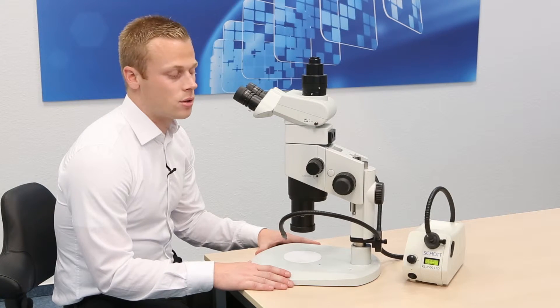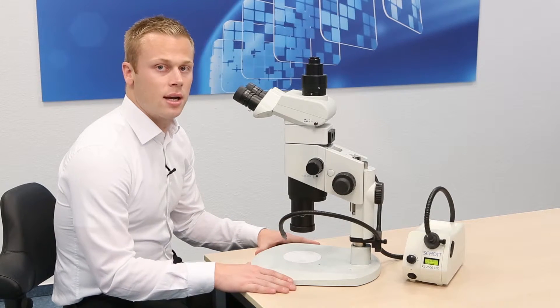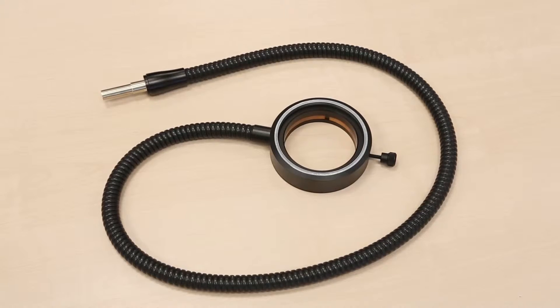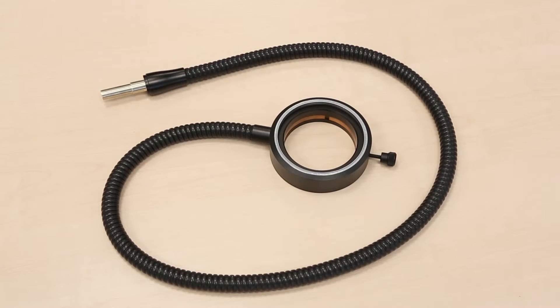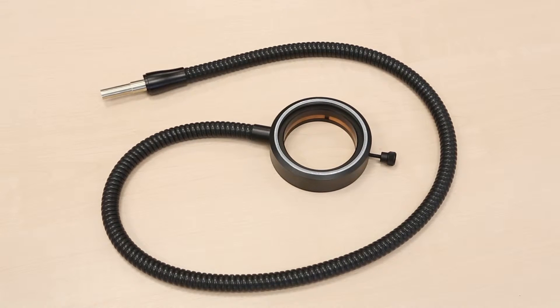It's also operable with either the gooseneck as you see here or a fiber optic ring light. Let's stick with the gooseneck for the time being.